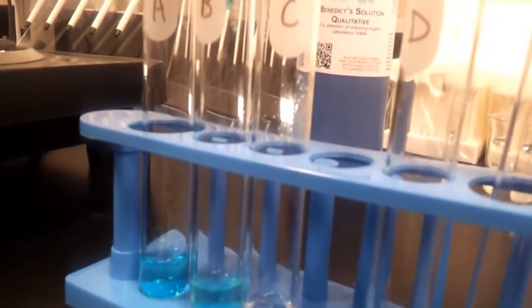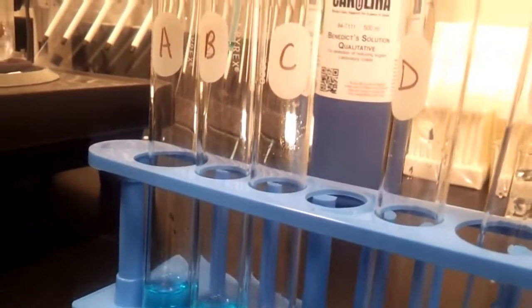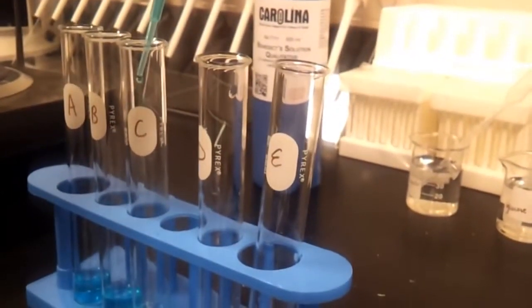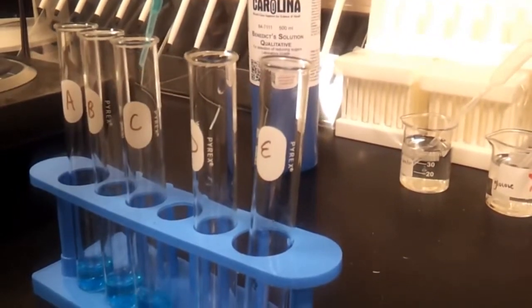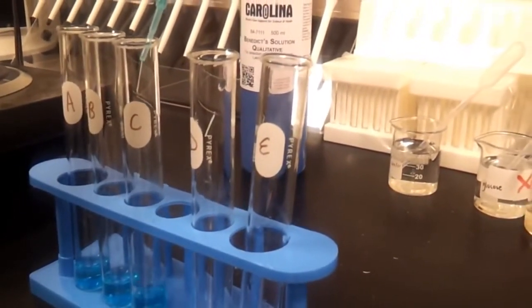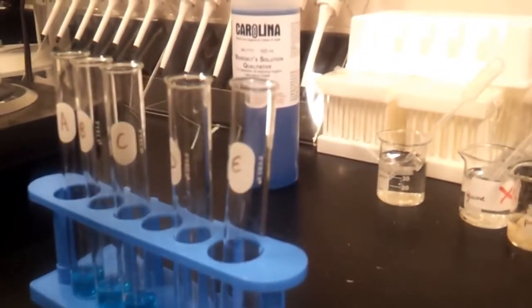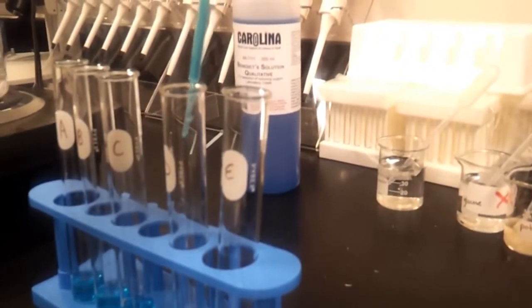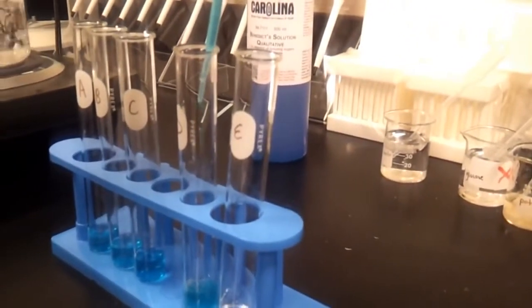Adding 20 drops to each of the remaining test tubes, counting as I add them.